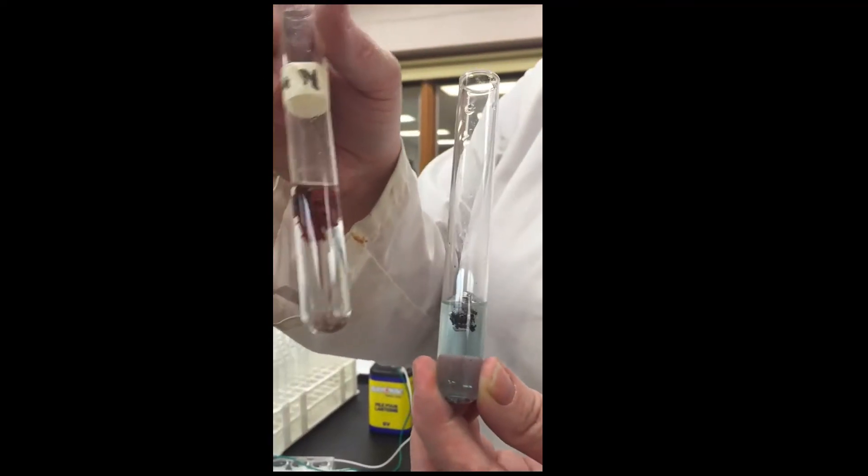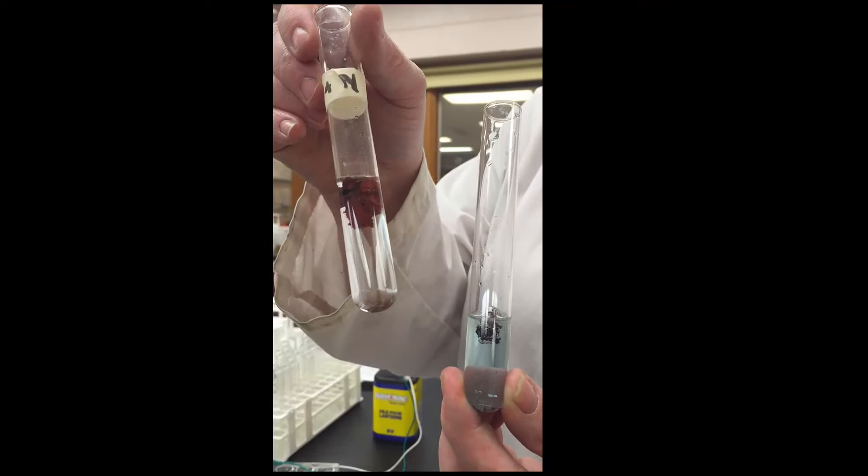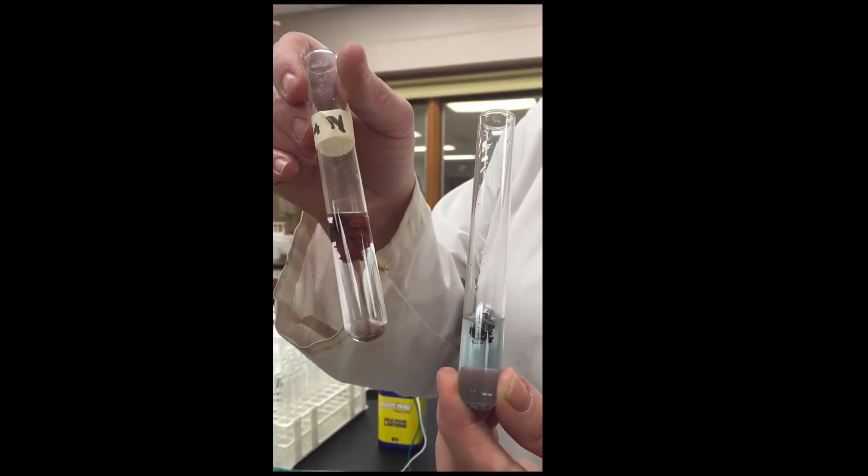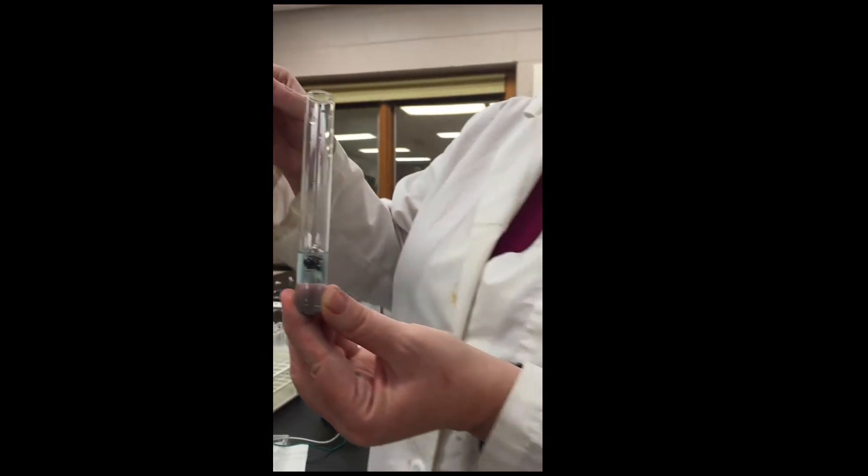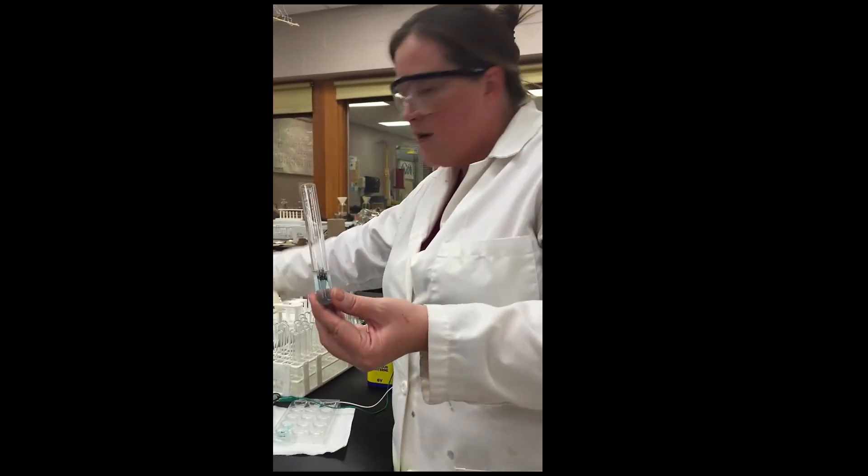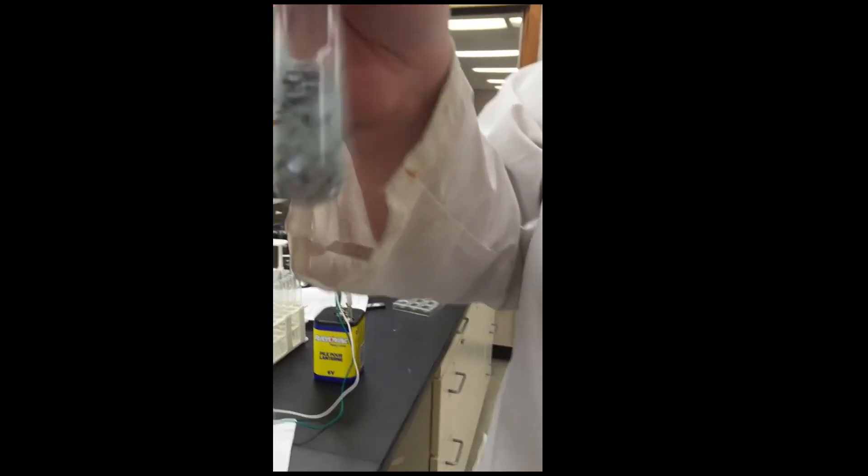If we were to isolate that solution and evaporate off all the water, it would leave behind a white powder, which is the aluminum chloride. I'm just going to shake this a little bit more.